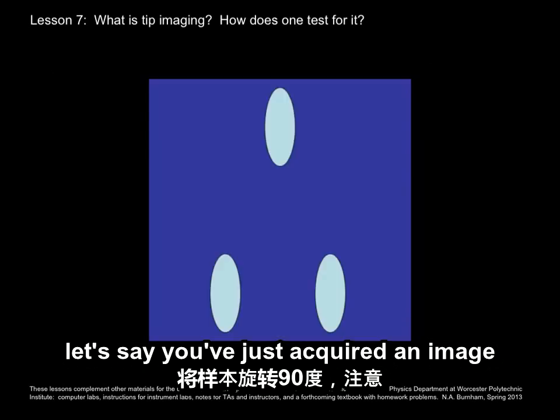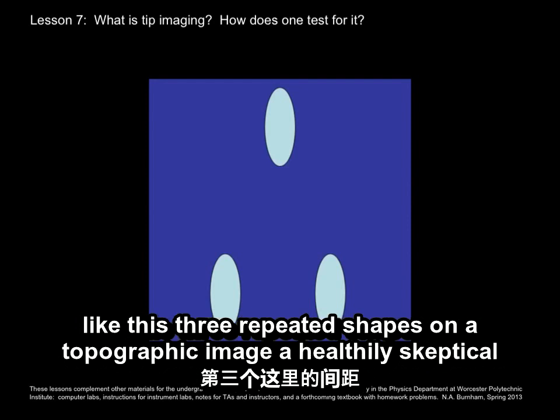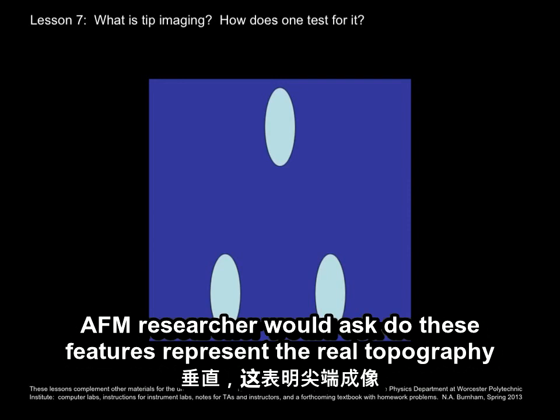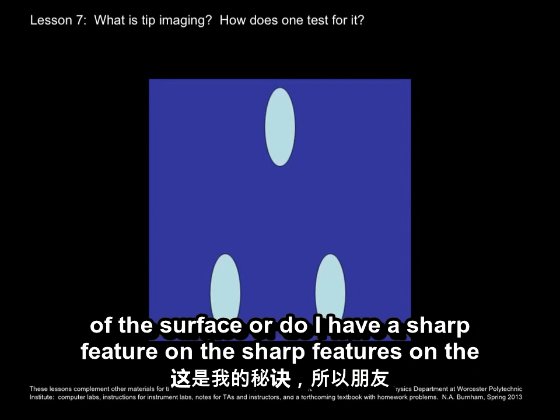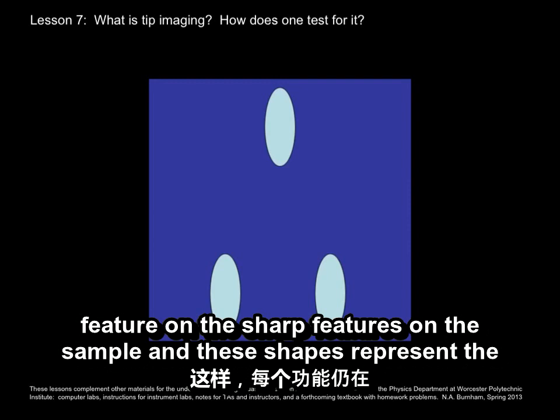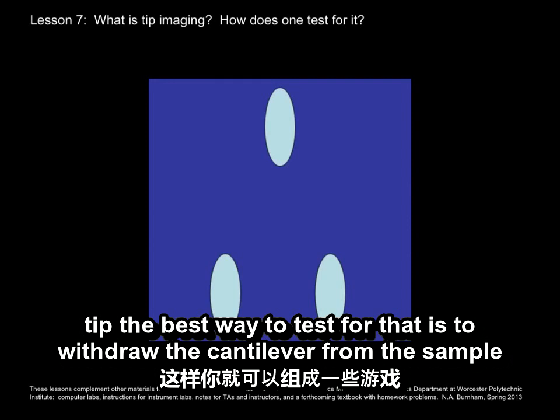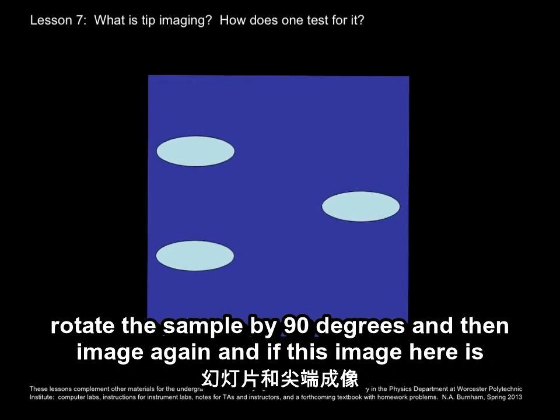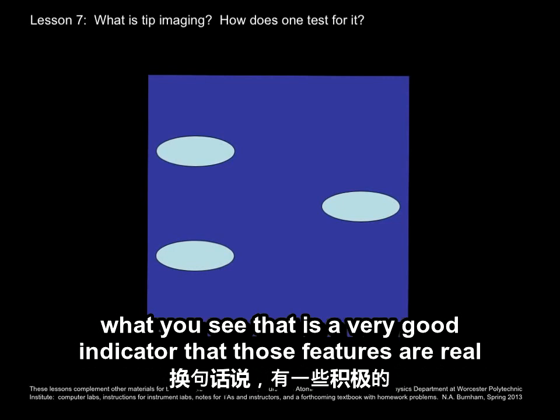Let's say you just acquired an image like this, 3 repeated shapes on a topographic image. A healthily skeptical AFM researcher would ask, do these features represent the real topography of the surface, or do I have sharp features on the sample, and these shapes represent the tip? The best way to test for that is to withdraw the cantilever from the sample, rotate the sample by 90 degrees, and then image again. And if this image here is what you see, that is a very good indicator that those features are real.